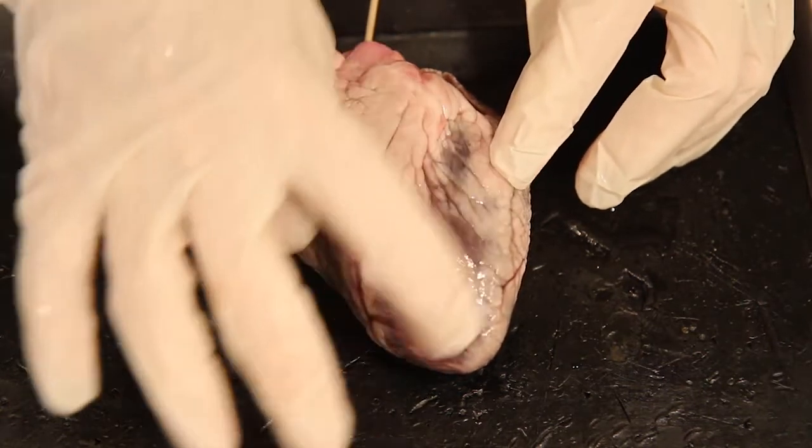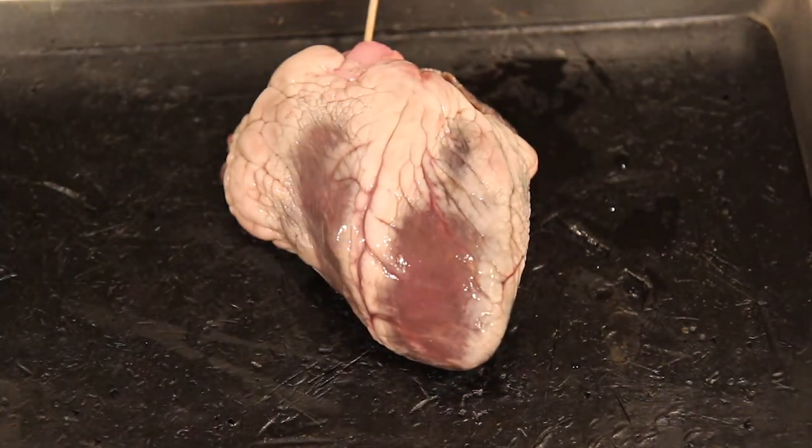The shiny layer on the outside is known as the visceral pericardium, because it's attached onto the viscera, which is the heart.